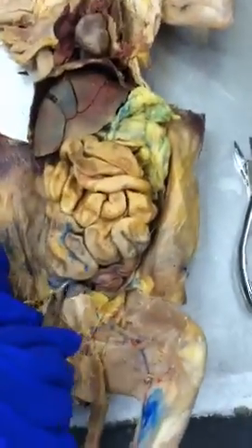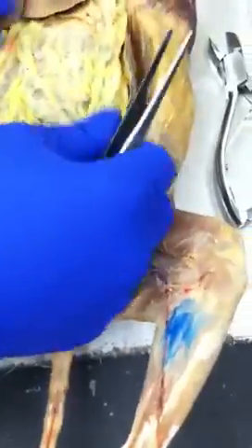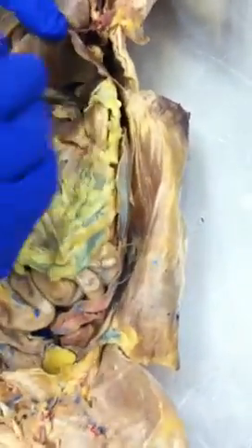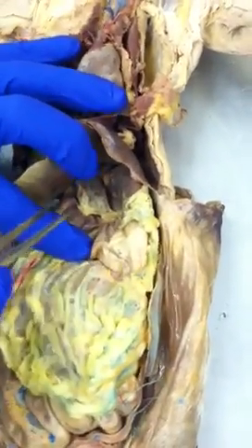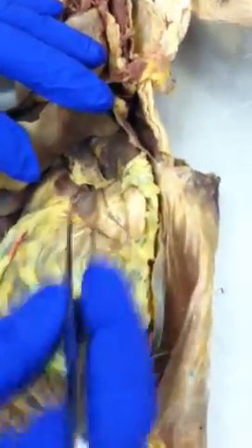So let's just go through the digestive system, and then we'll go through the respiratory system. All right? You see, this is the bladder right here, part of the urinary. It's empty, it's dry. But like I say, this starts off like that, right? With the greater omentum. The greater omentum, so-called, why? Because it's attached to the greater curvature of the stomach. You see the bigger curve, like I was drawing on the board? That's the greater curvature. So this is the greater omentum. You can see the lesser omentum over here. You see on the lesser curve, the smaller curve of the stomach, this will be the lesser omentum, okay? So lesser omentum and lesser curvature of the stomach and greater curvature of the stomach and the greater omentum, okay?